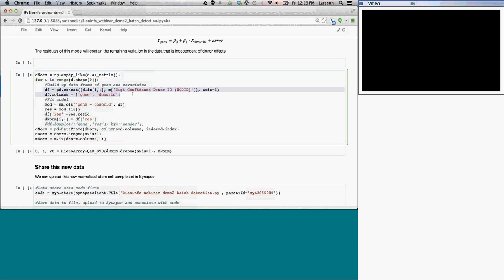So here I'm just building the data set that I need, and here I'm building a model. So I'm saying that the gene expression is proportional to donor ID. Then I fit the model, and I extract the residual of that model. And then I store the residual of that model in this new data set that I have, dnorm. And then at the end, I'm just going to put these all together into one large matrix and throw away all the samples where there's no information. And since not every sample has a donor ID, some of these samples will disappear from this. And then since I had thrown away some samples, I'm also going to throw away those from the metadata, so I have a coherent data set between the normalized and the metadata.